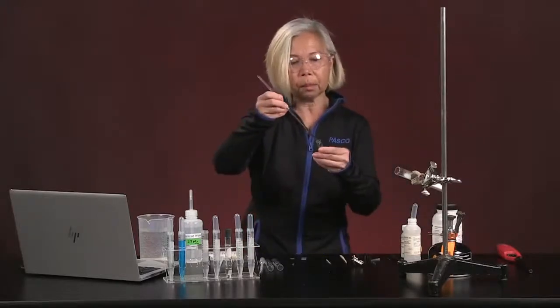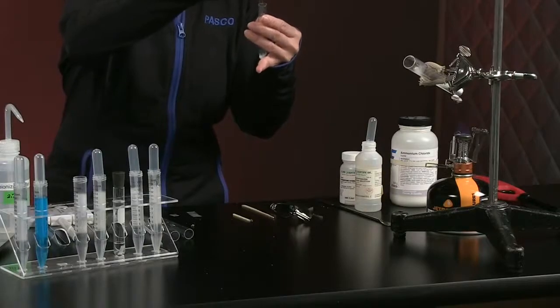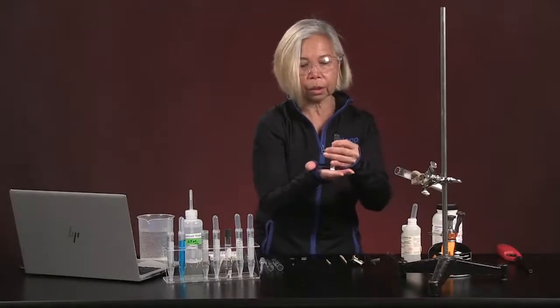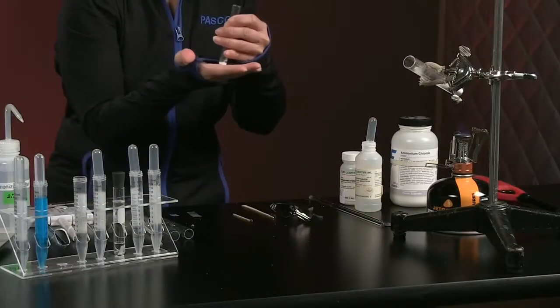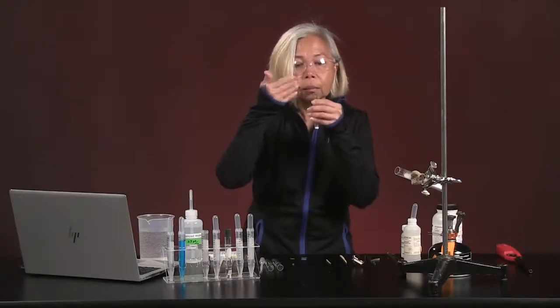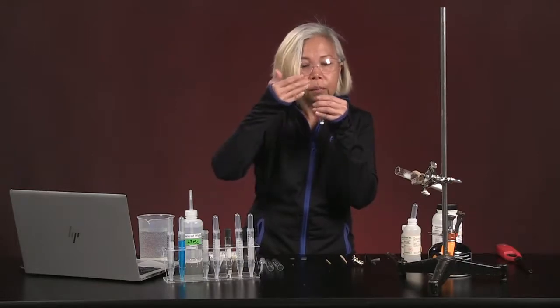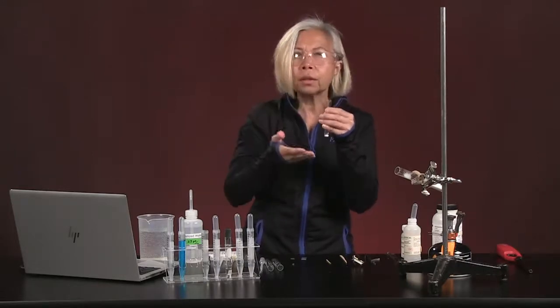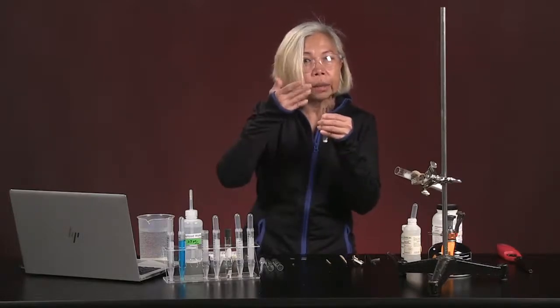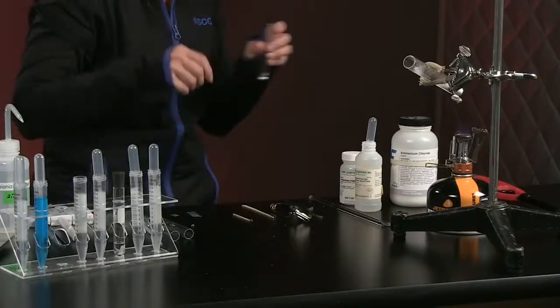I'm actually going to mix them together really well. So these are two solids we're mixing with each other. And I will tell you, the test tube has gotten cold. Remember how you sniff something in a chemistry lab? You waft it towards you? There's an aroma of ammonia. So it's getting cold and it smells a little bit like ammonia. So that's an important observation to make.